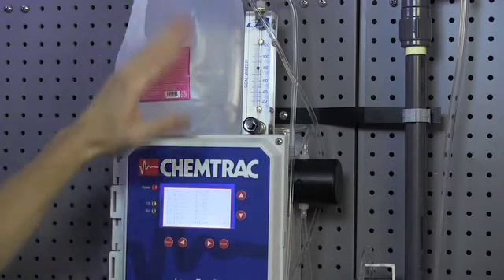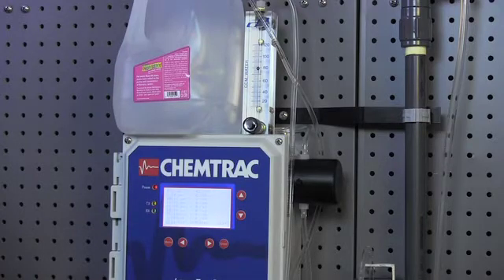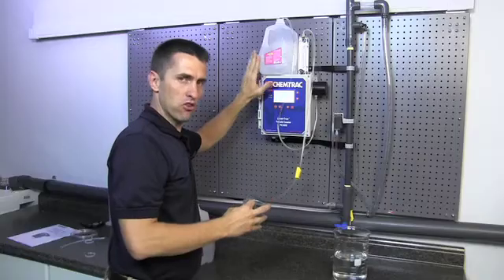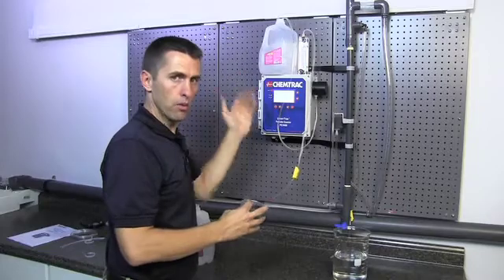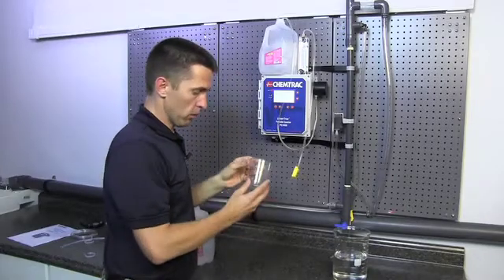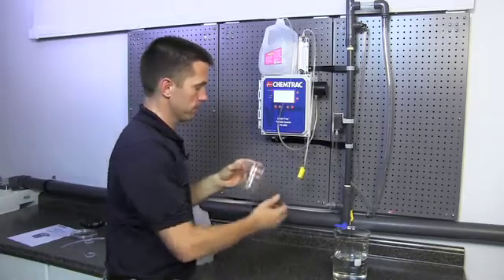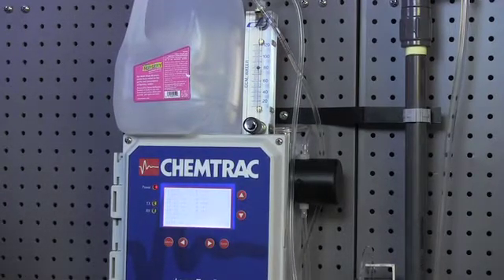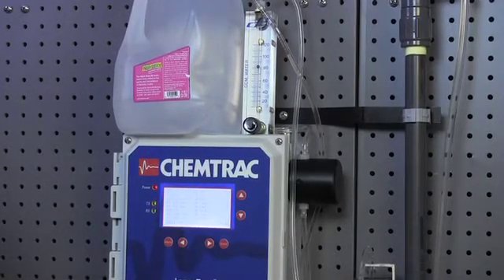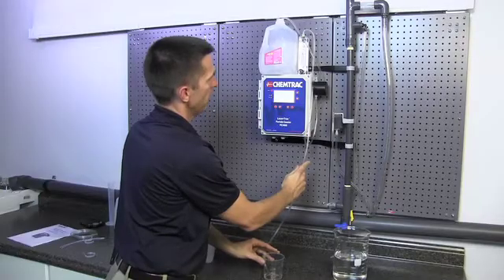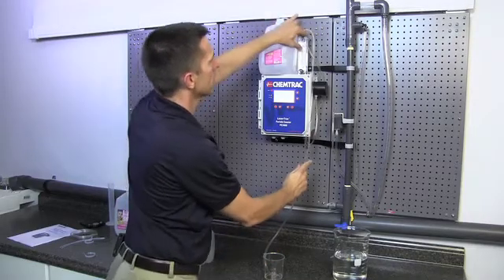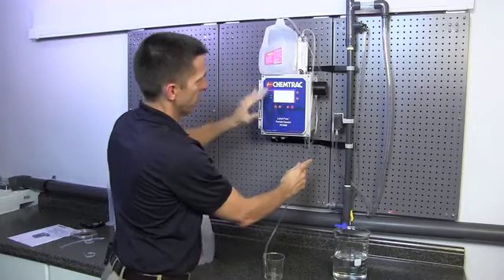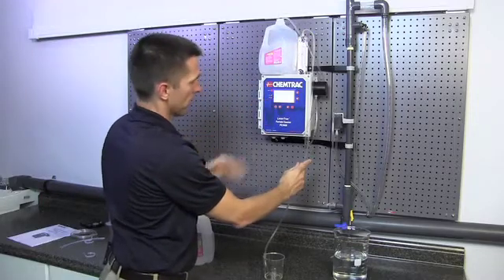When we make our solution, we need to know how much volume is left in this jug after we check the counts to make sure we have low, what we call blank water counts. So we'll be catching the water in this container and we'll simply start the flow up, get it back up to 80 milliliters per minute. Now once we have it at 80 milliliters per minute, we're just going to wait for a couple cycles and make sure that our counts are low.